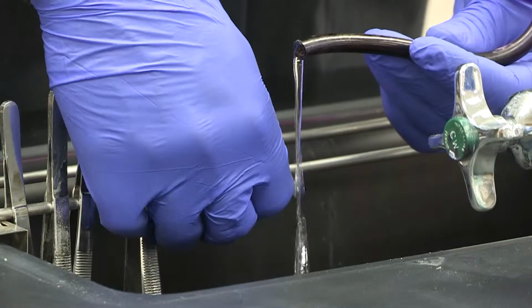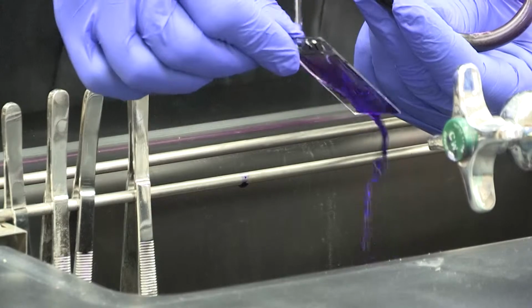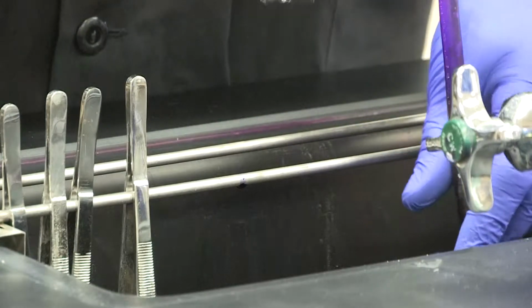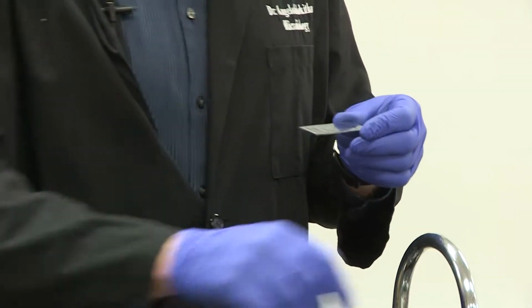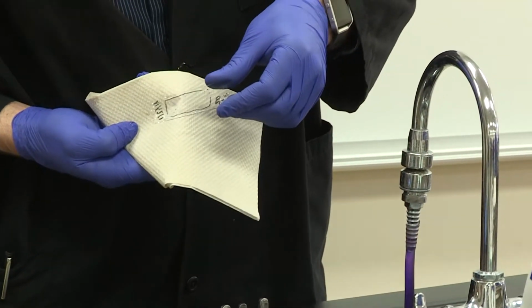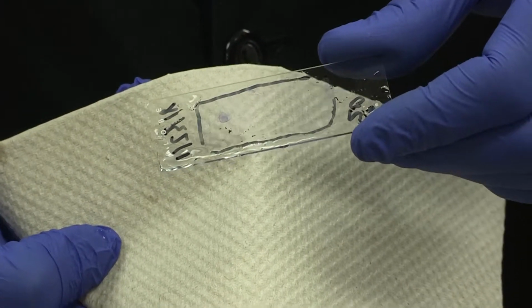So the method that I like to use is to let the dye kind of run off and let it cascade down from the very top. Okay? Don't put that water directly on your bacteria, rather let it cascade down. Okay? At this point, you should see a little bit of purple on your slide. And so you probably can't see this very well on the video, but I do have some purple spots right there.